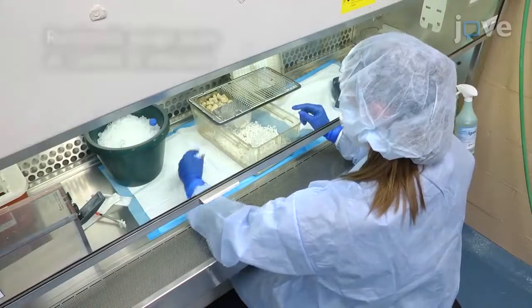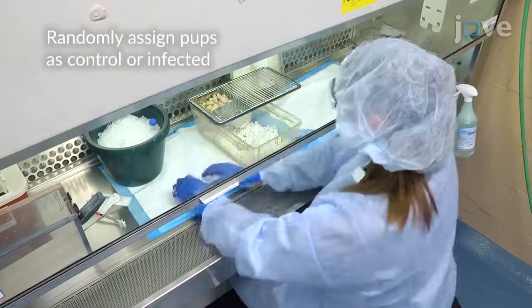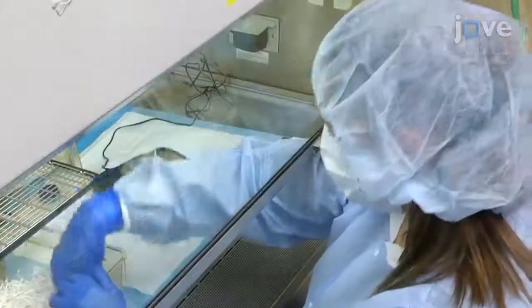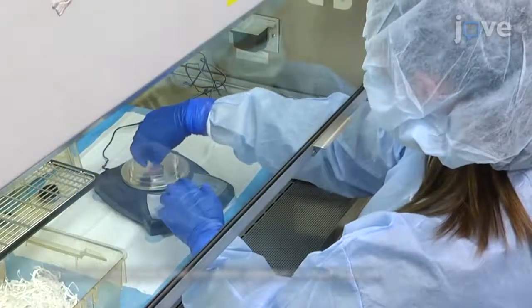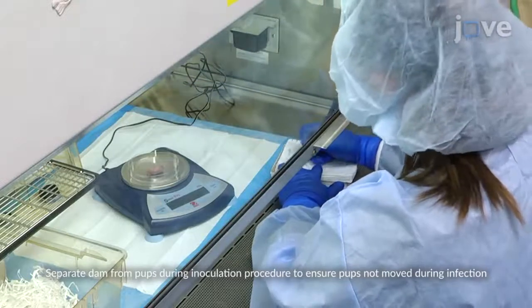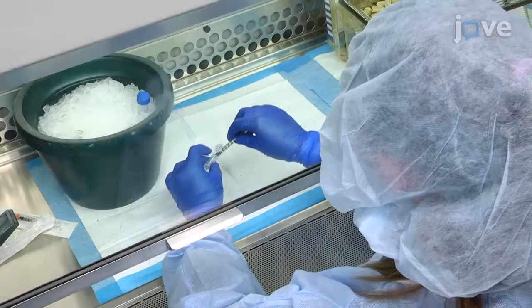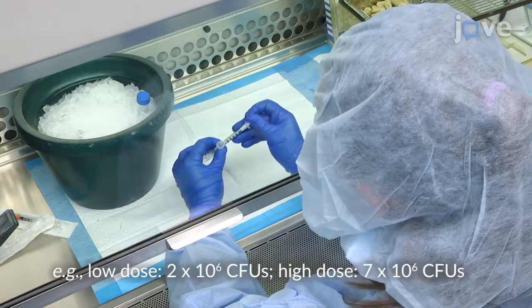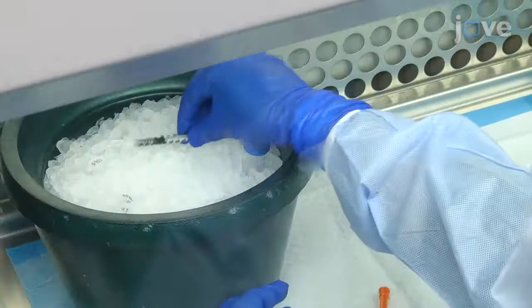Begin by placing age-matched pups into either high or low-dose litter groups within a biosafety level 2 cabinet. On postnatal day 3 or 4, record the weights of all the pups prior to inoculation. Load insulin syringes with PBS, or the high or low-dose E. coli Lux inoculum in the biosafety cabinet, and place the loaded syringes on ice.